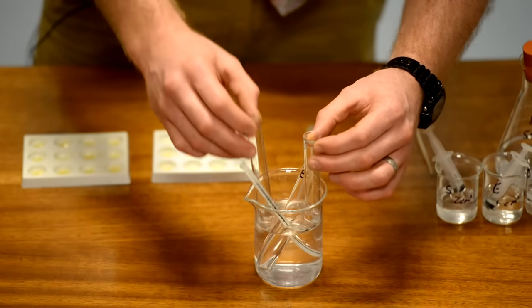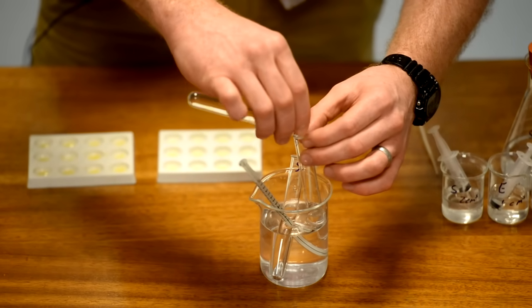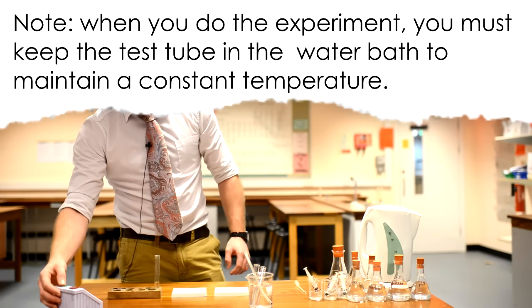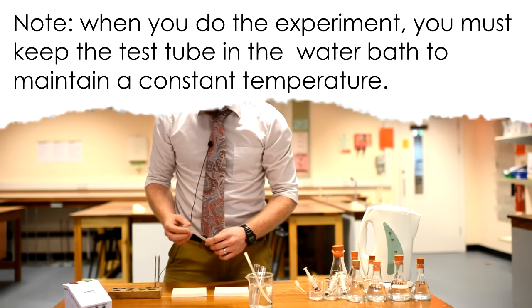There's one and there's two. Once you've added the three solutions together, the enzyme will start digesting the starch solution so you need to start your timer straight away.